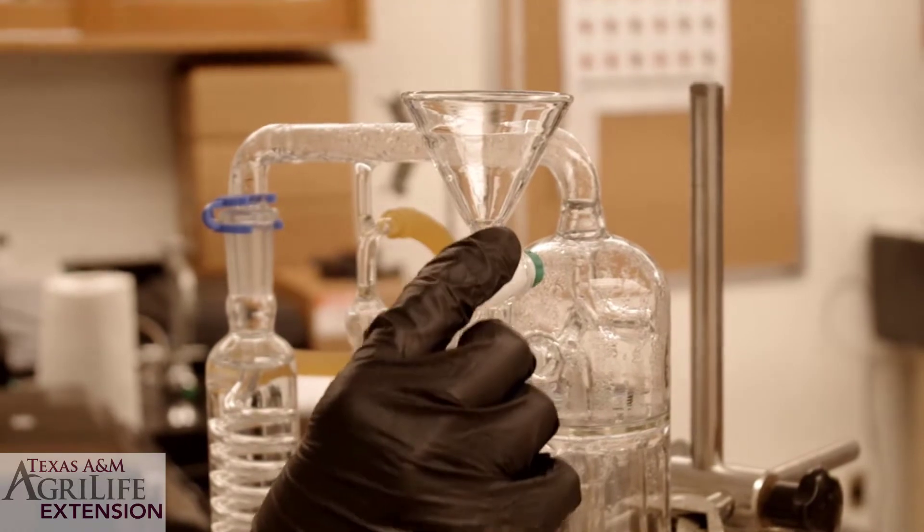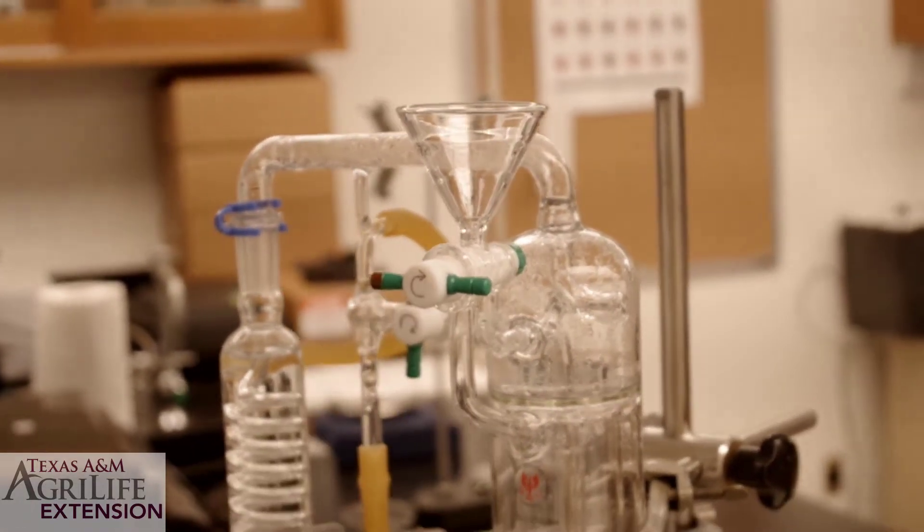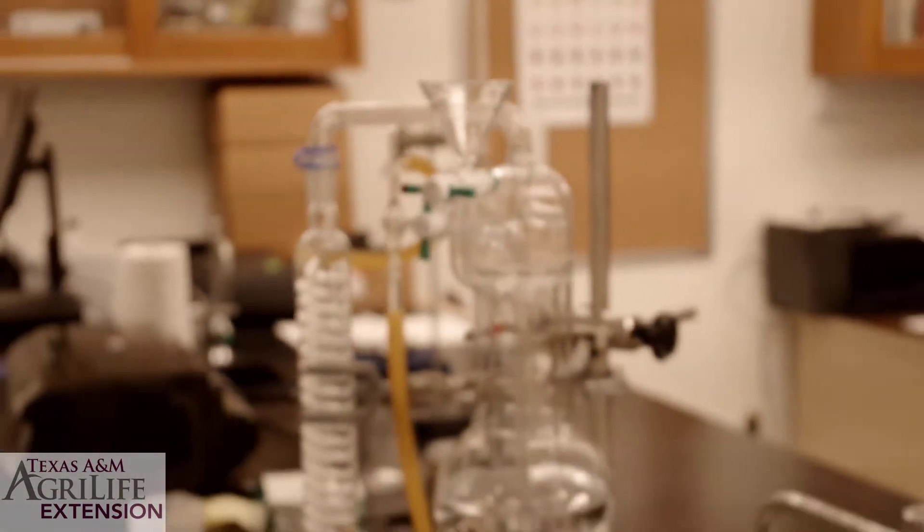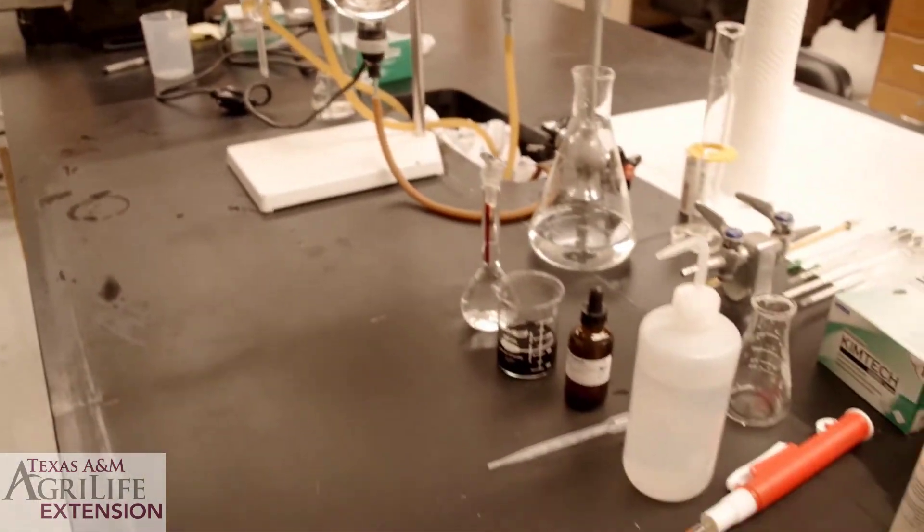We are now ready to add our sample. With the stopcock now in the closed position add 10 milliliters of your wine sample.